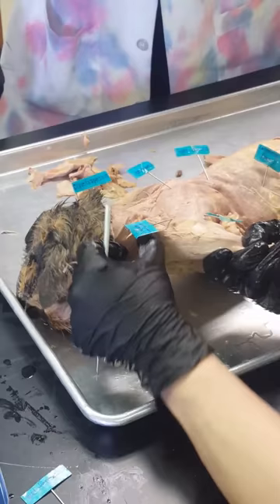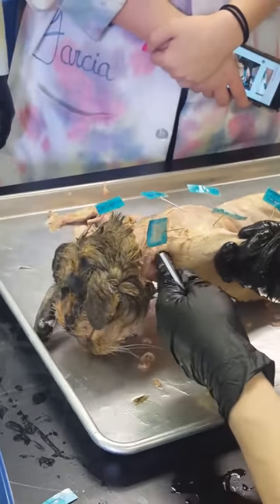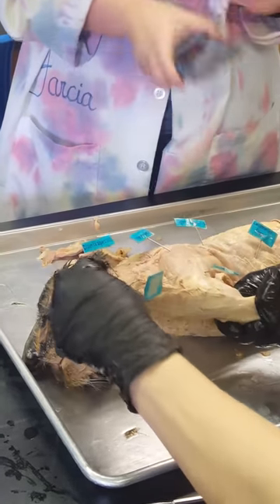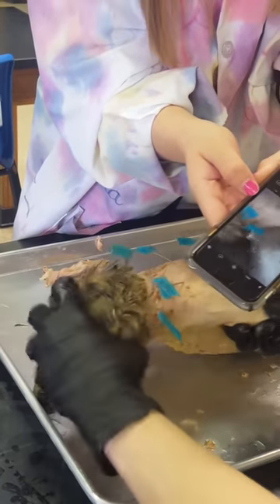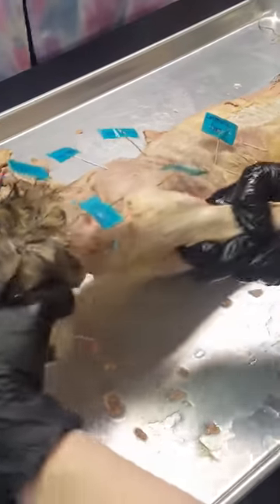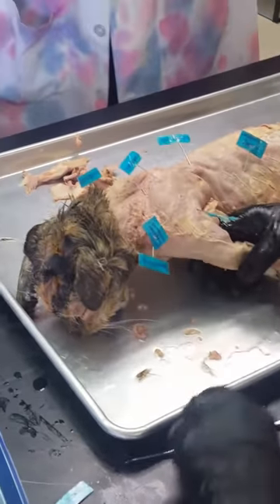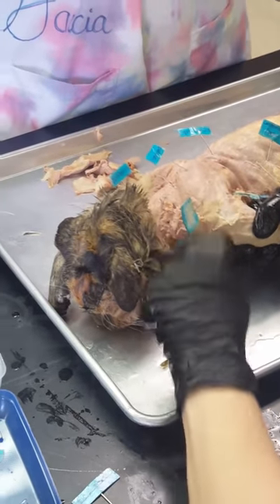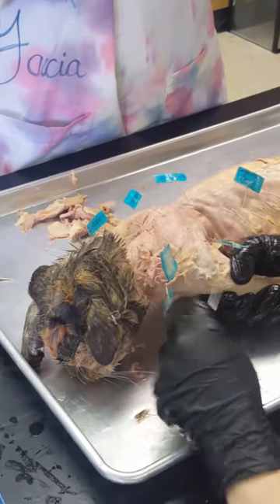To see clavodelt you have to clean the goo off. Remember the back is clavotrapezius, and then you see this crook where it bends — that is clavodelt, also known as clavobrachialis. The delt is right here in the crook; see where I'm bending it. That strap going into clavotrapezius is clavodelt. The last one is the hardest to find because it's covered up by tendon — right inside here underneath this tendon is acromiodelt.